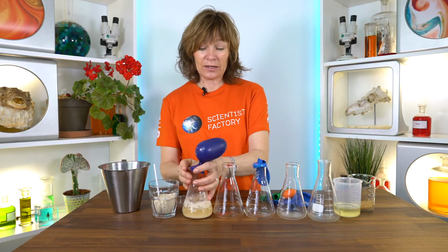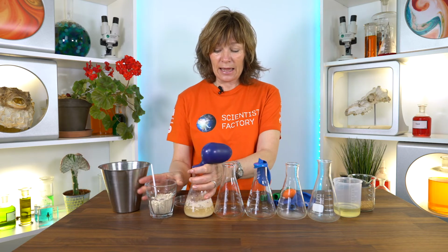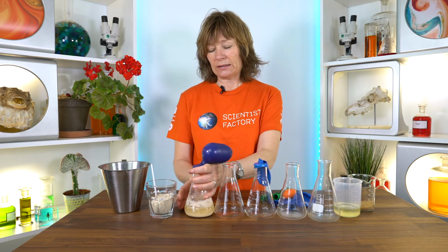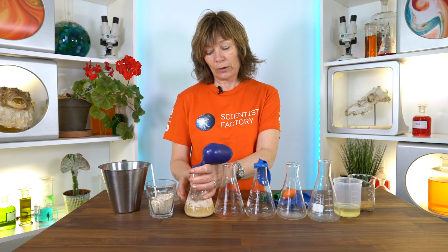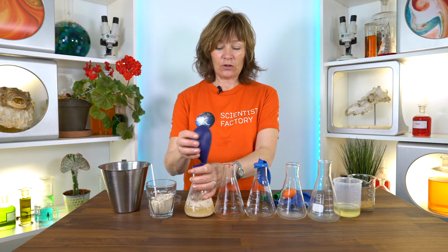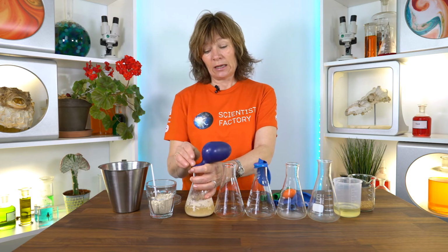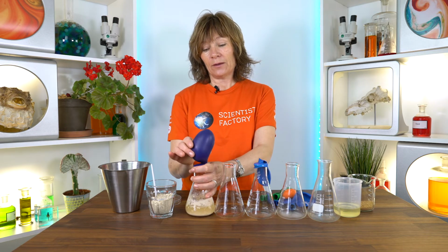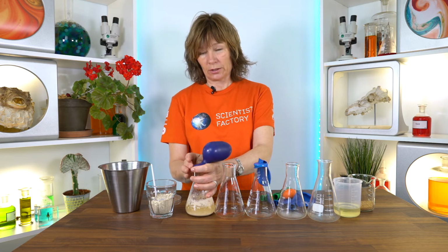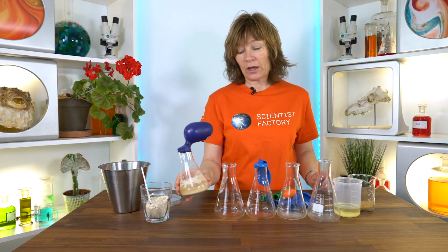And as you see here, yesterday I did that with this mysterious substance, and I added, because I think it needs water, and I thought also it needed sugar, so I added sugar and water, and you can see it woke up. It became alive, and it started to metabolize the sugar and produce gas. So there is certainly something alive in here. But this is not the final solution.